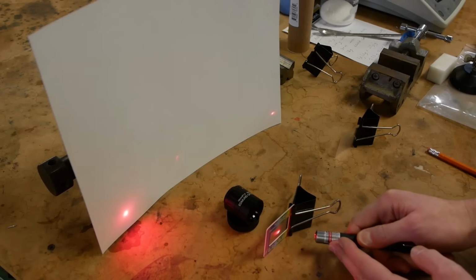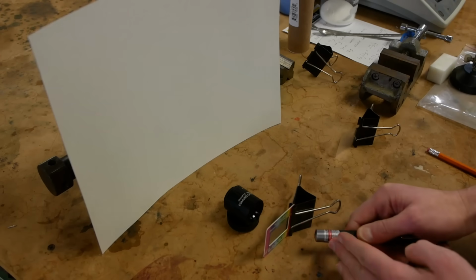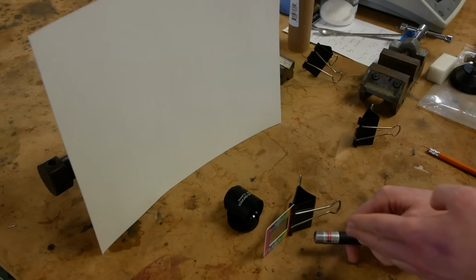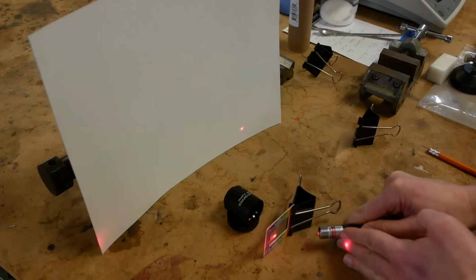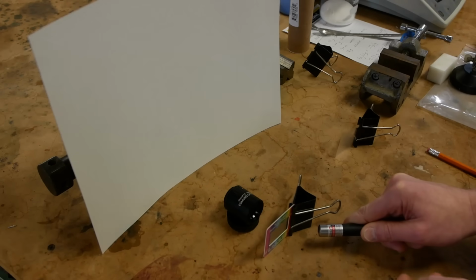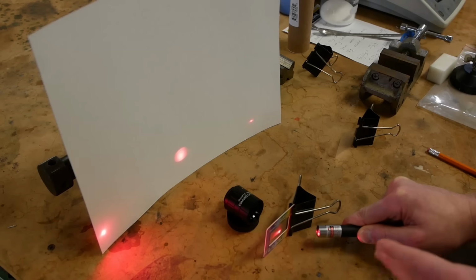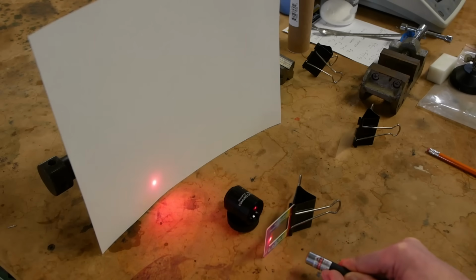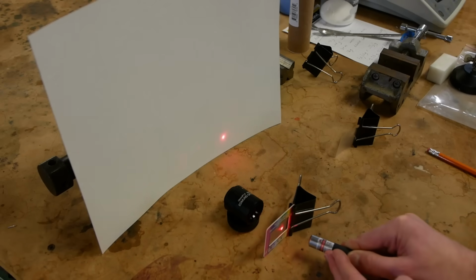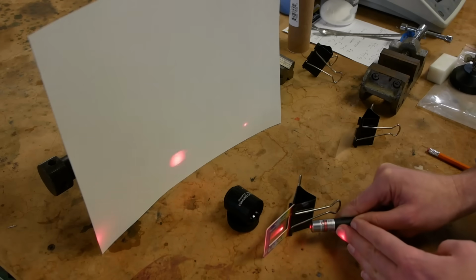In fact, we can capture images all along these different angles and be able to determine the number of lines per millimeter in our unknown grating just based on how far we've rotated our light source around and figuring out if there's any light coming through there. And remember, a real slide that has animal or plant cells or whatever is just a very complicated diffraction grating that has all number of different lines per millimeter. So as we're sweeping through all these different angles, we're capturing different types of spatial density, different spatial frequencies for every one of these angles.